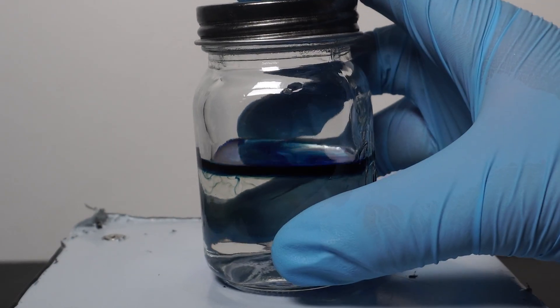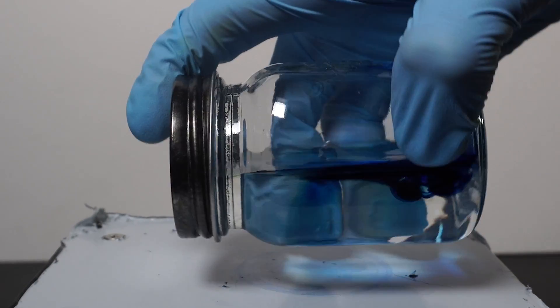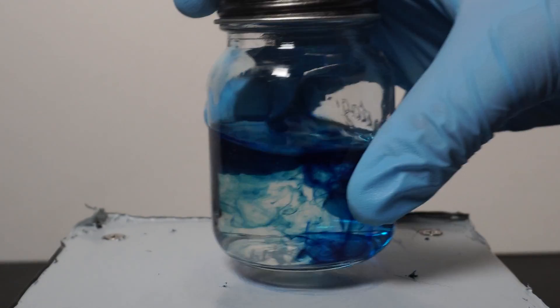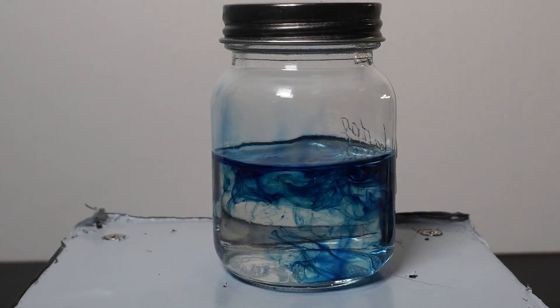In today's video, we're going to be demonstrating the blue bottle exercise. This project is used through our college curriculum as an example of reduction-oxidation reactions.